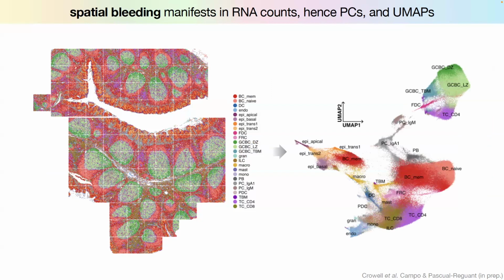It's really nice in this case because these bubbles here are like germinal centers. This cluster here is the epithelium. It's also very separate, right? And then all of this is like the T cell zone kind of in between the bubbles. But the problem here is that we have this B cell cluster that's completely split into two.